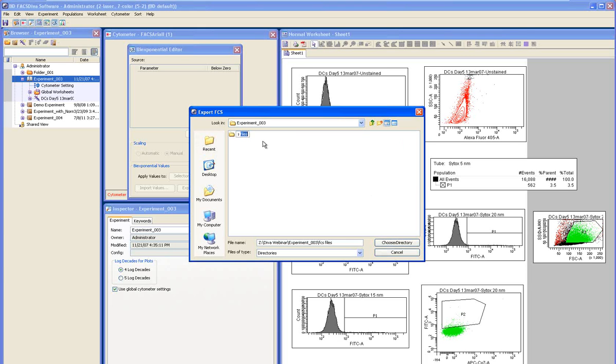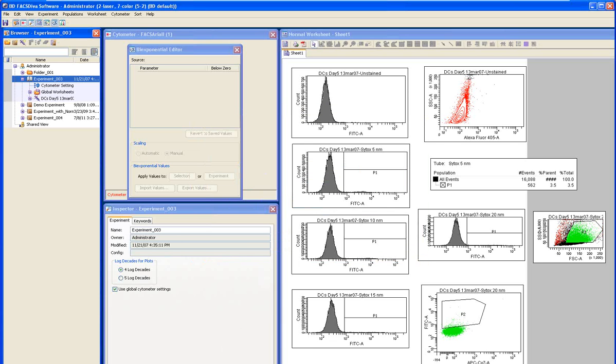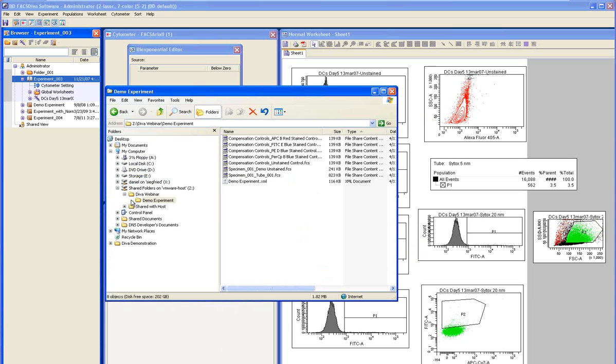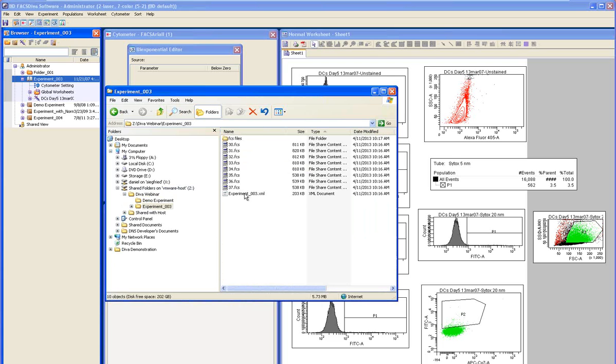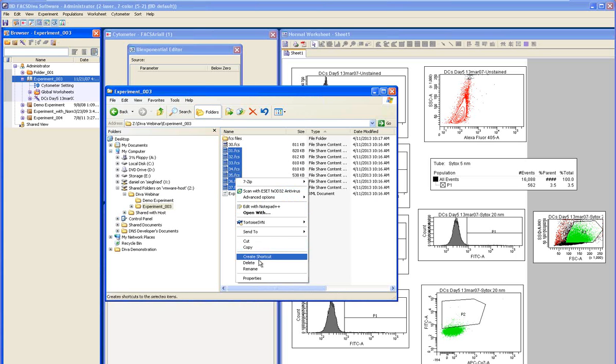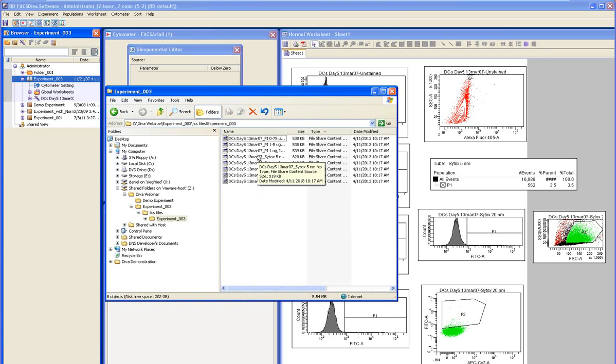And we'll choose directory, and we'll save them out. When we look in Windows Explorer, you can see that we have experiment 003. We have the experiment with its numerical files. I'm going to get rid of them, but leave one behind this time. Let's delete that. And under FCS files, again, it recreated experiment 3 and the data files.